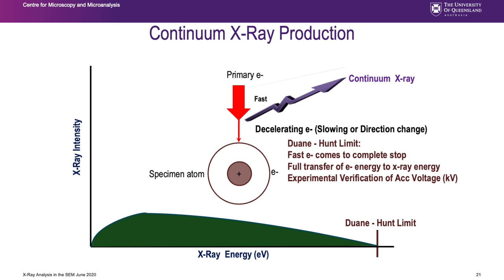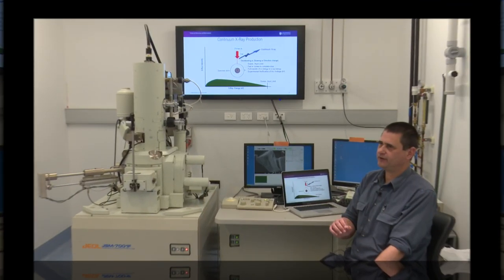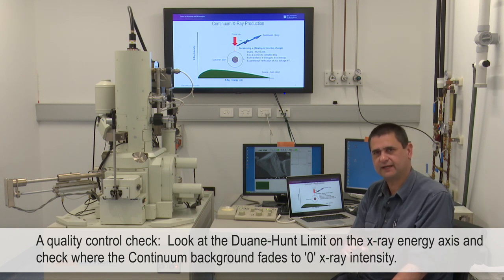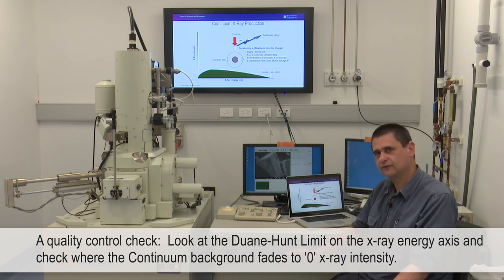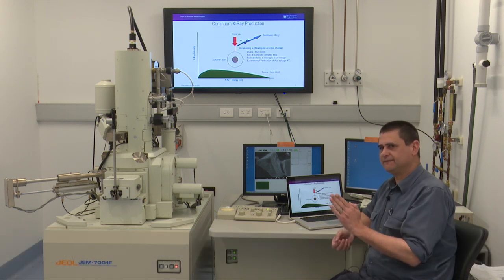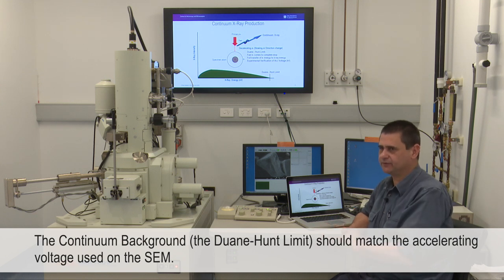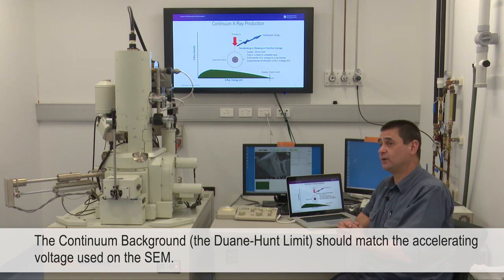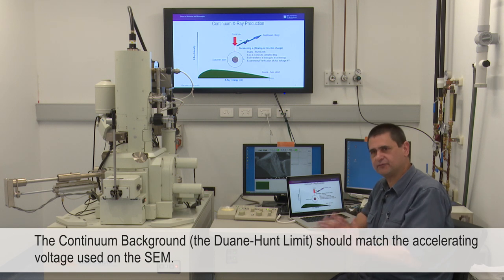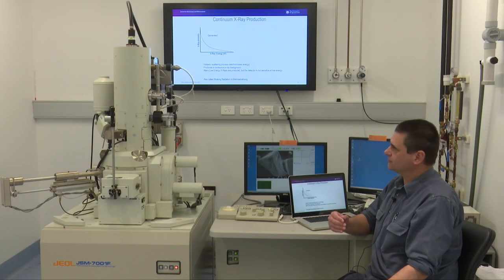Quality control is very important in X-ray analysis. One of my first checks is to look at the Duane-Hunt limit - where the continuum background fades to zero, where no X-rays are being produced. You usually have to project it, and that should be very close to the accelerating voltage. I don't mind if it's out by a few hundred volts in 20,000 volts, but if the Duane-Hunt limit doesn't match the accelerating voltage by a few kV, you have a problem and I wouldn't use that spectrum.